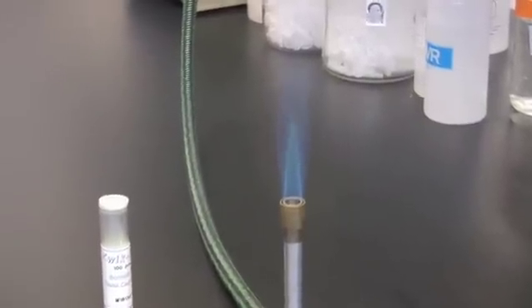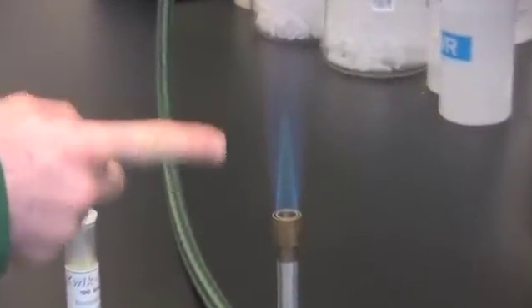Now when you light the Bunsen burner, you're trying to form a nice blue flame.